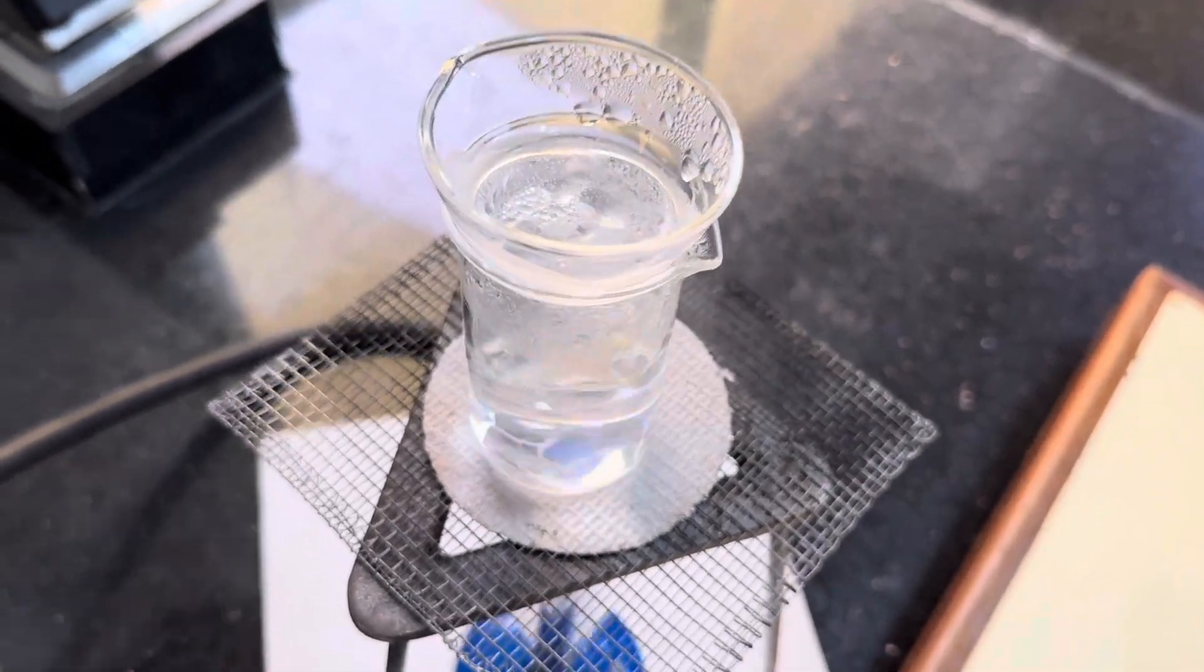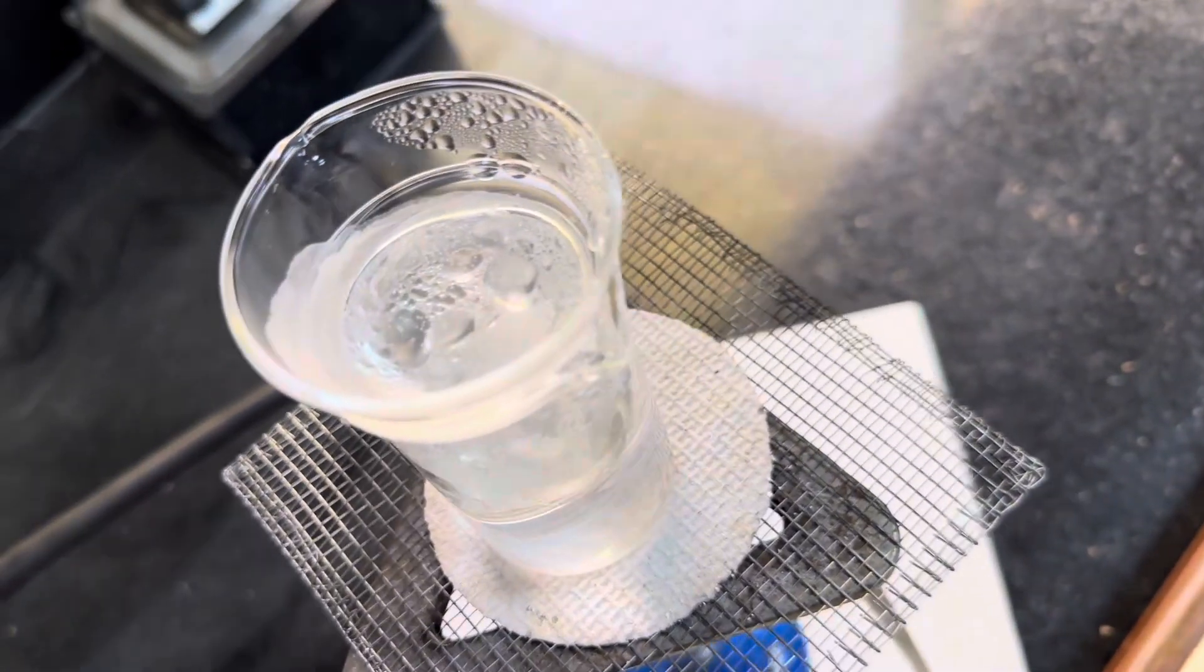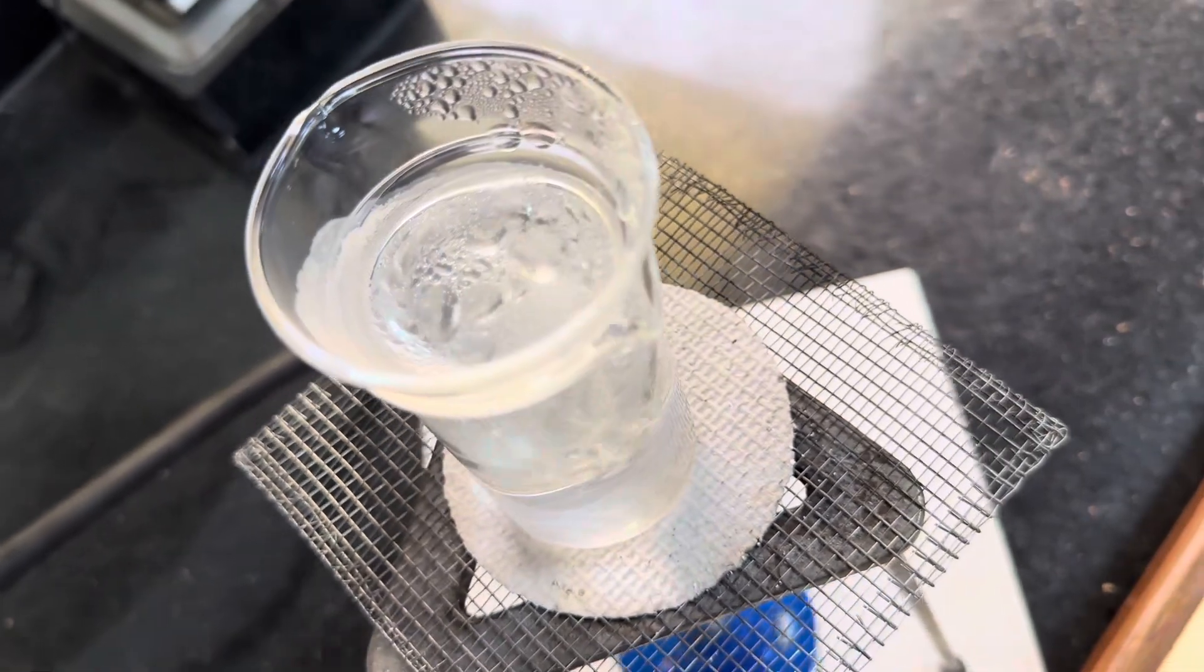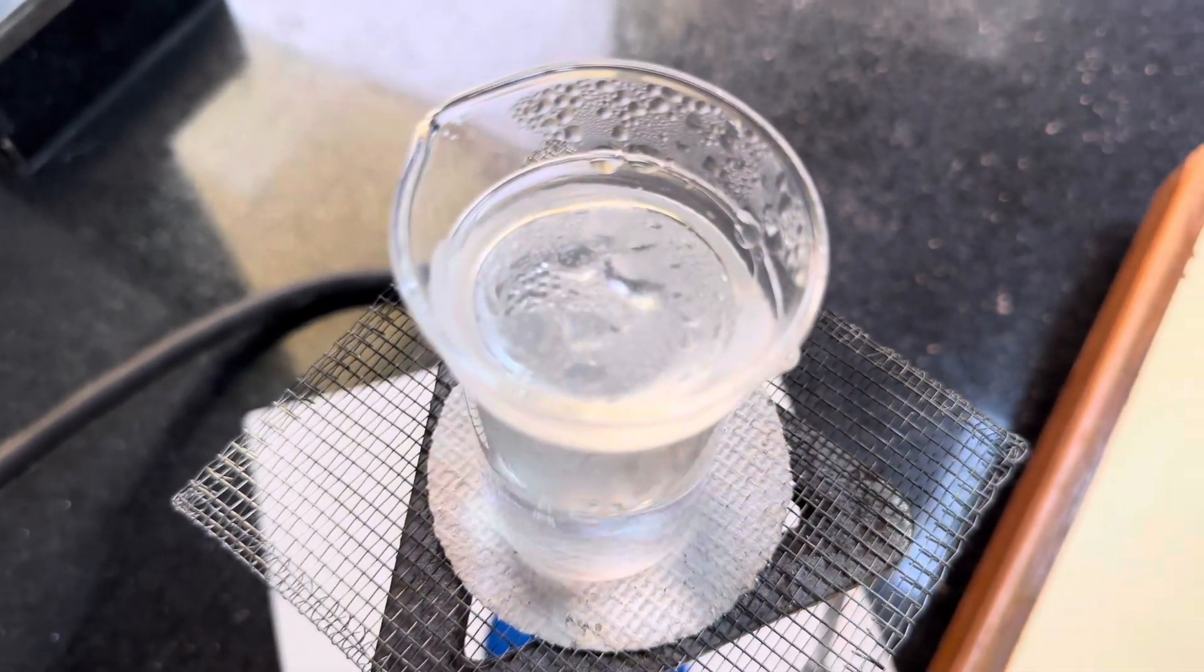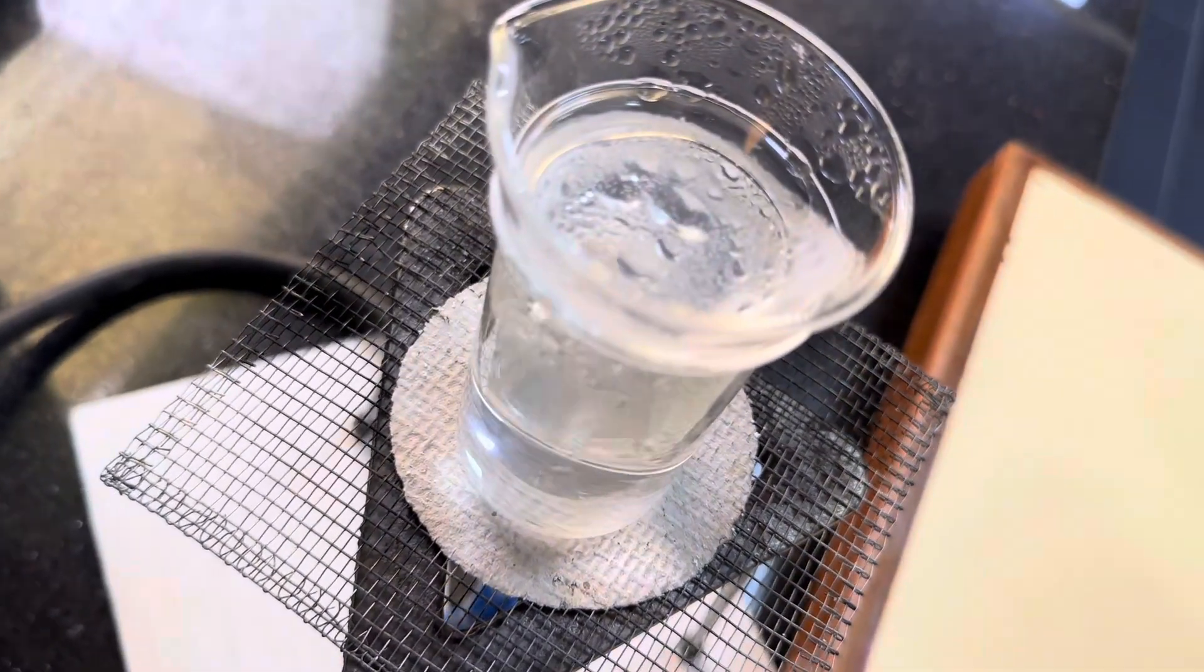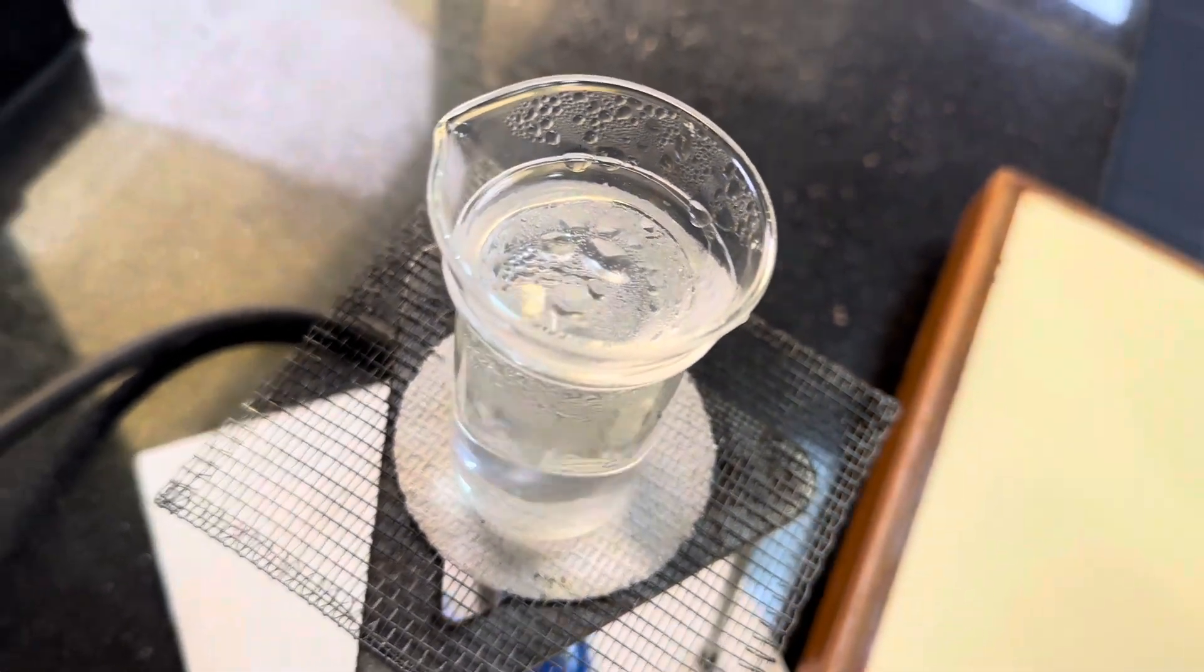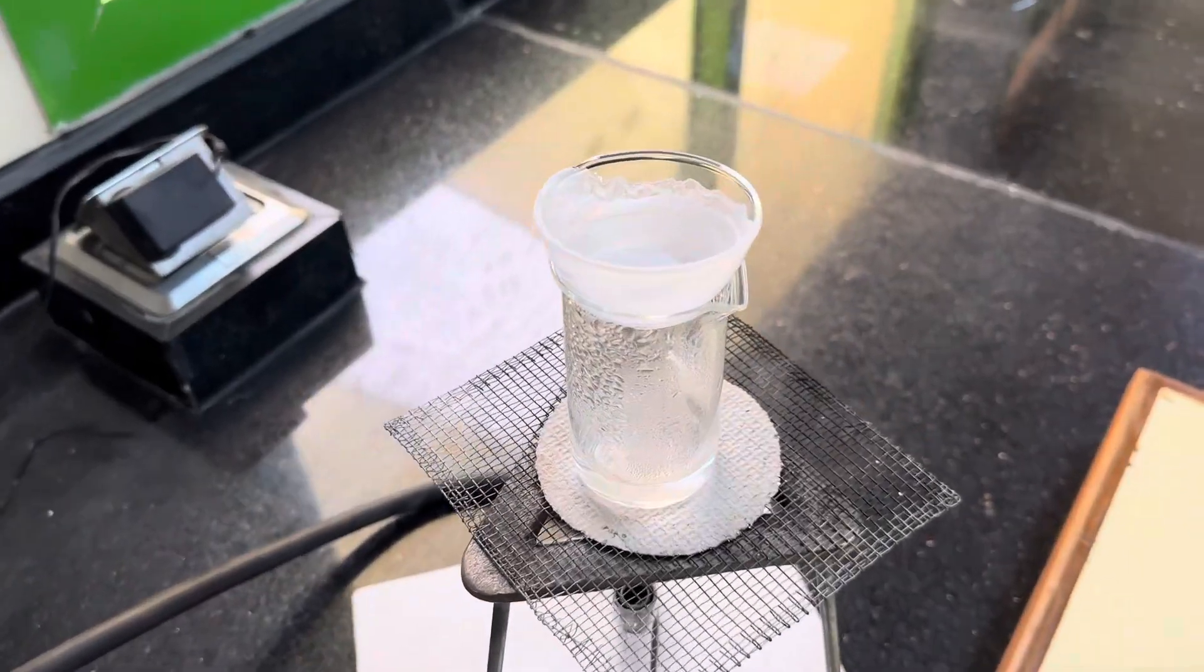This is what it looks like at the halfway stage. You can see some of the solid is forming at the side. And the solvent has partially evaporated. We're just going to leave it for now and we'll come back to it. This is nicely cooled down.